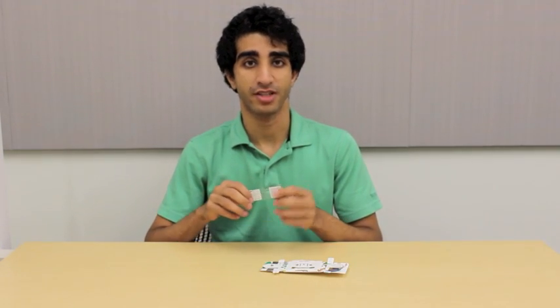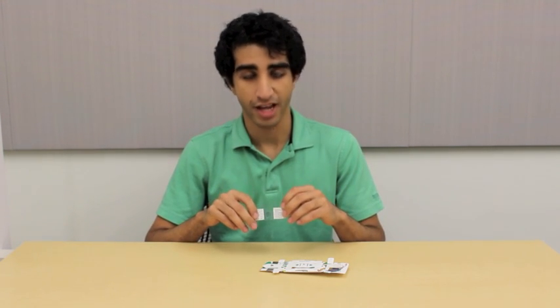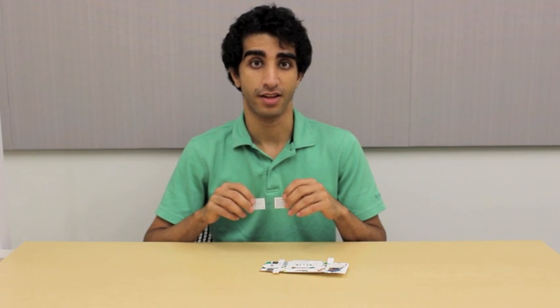If you don't have a pre-prepared slide, you might want to watch our next tutorial first, which shows you how to prepare a slide using materials provided in the kit.